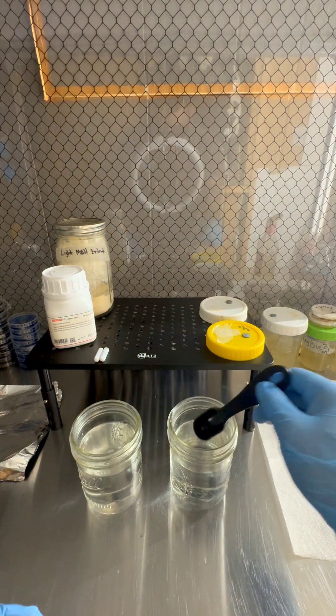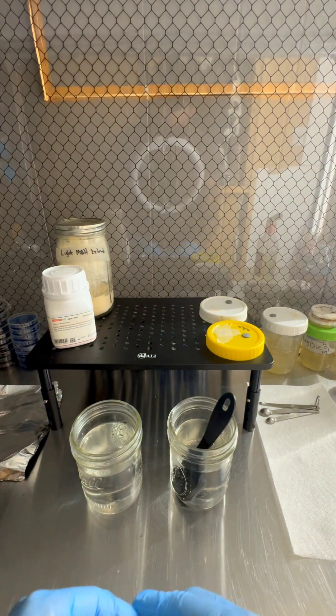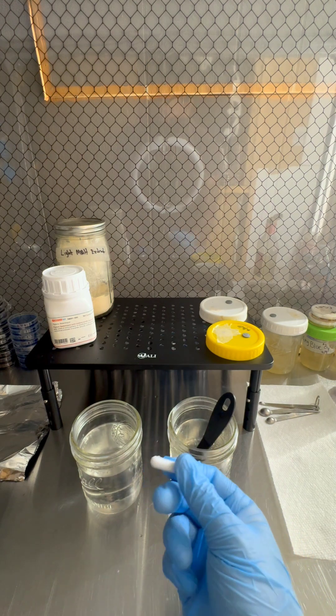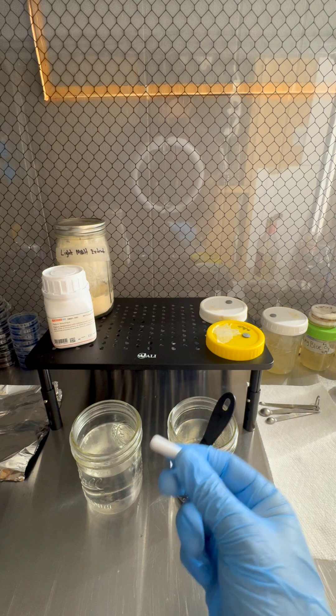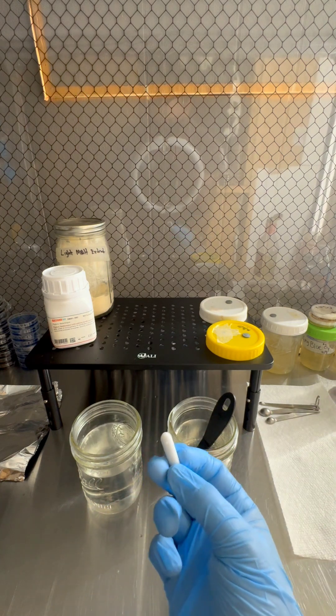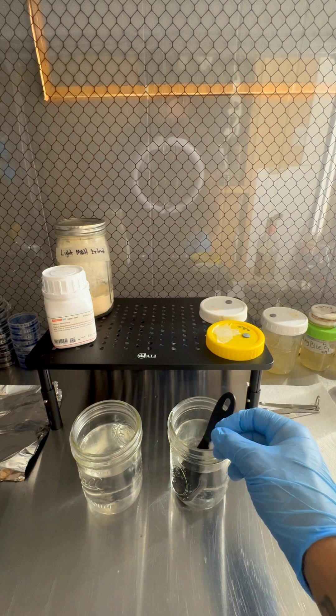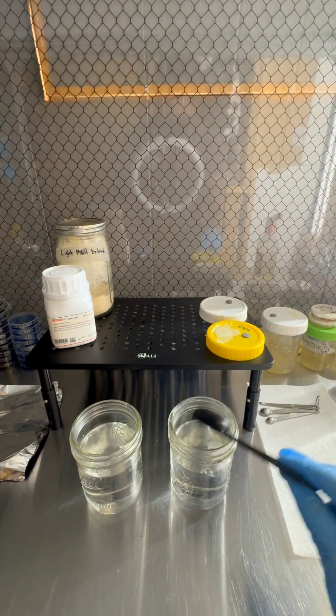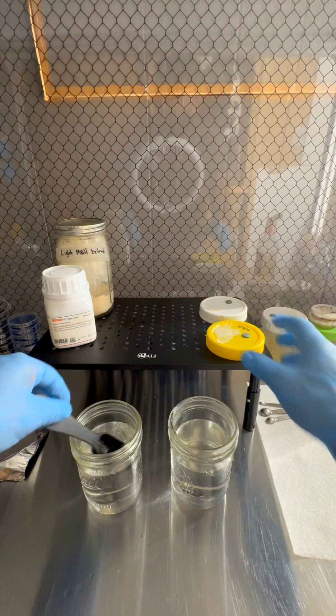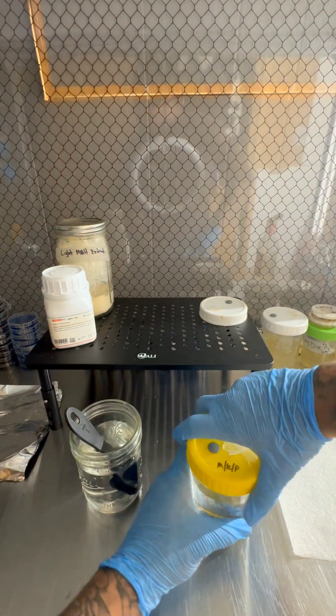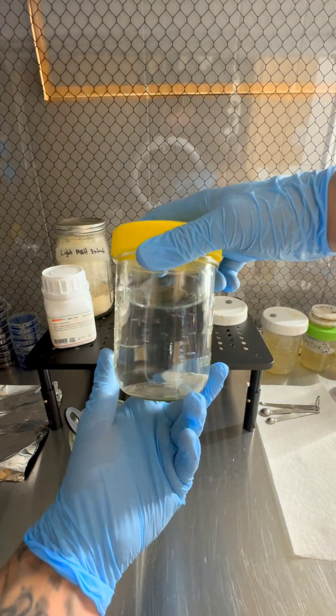So also, this helps for when your mycelium starts growing in the liquid culture. This helps to mix up your mycelium and break it up so you can pull it up in a syringe. So it helps if you get these magnetic stir bars. I like to drop those in there. So this one's done, so I'm going to go ahead and put a lid on it. This is just water and Karo's. That's all you need. So this is the basic recipe: water and Karo's.